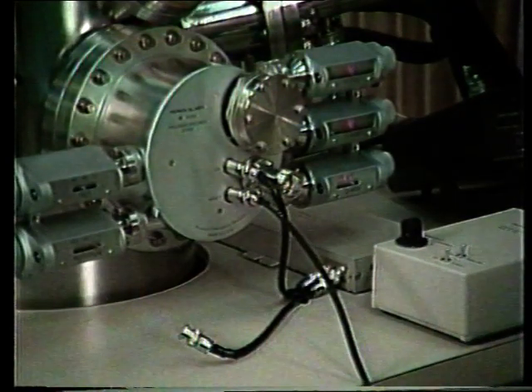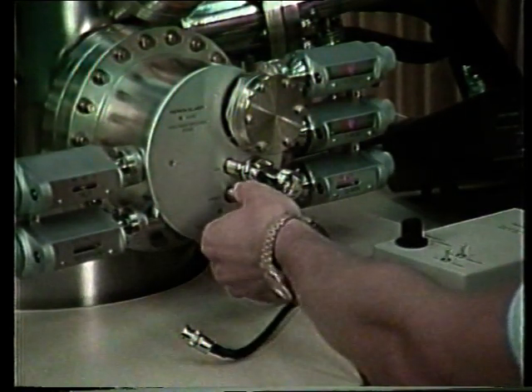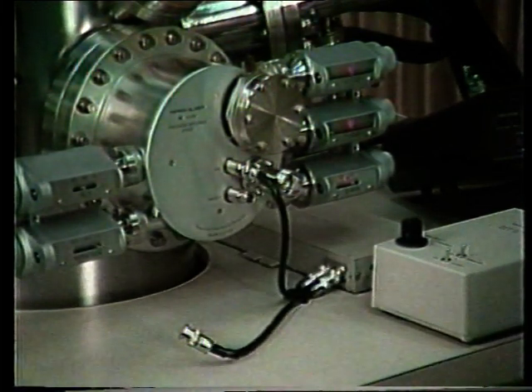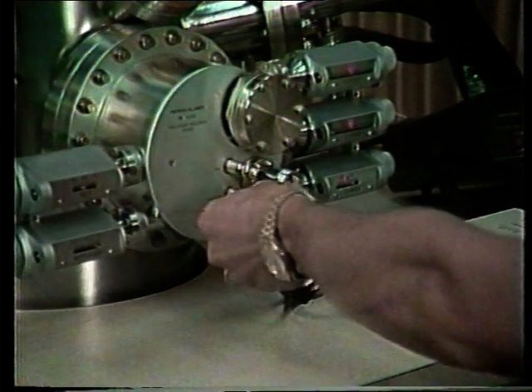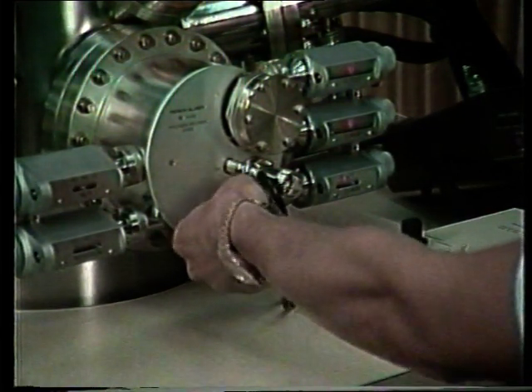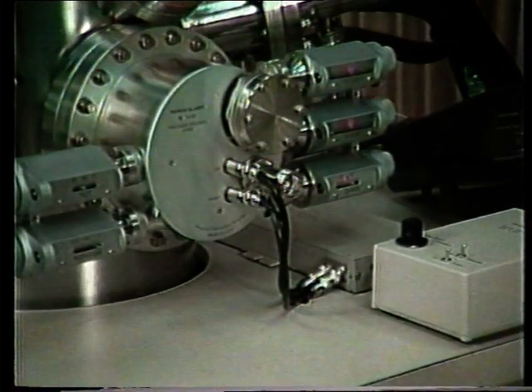With the electron gun now off, we are ready to disconnect the target lead from the battery box and reconnect the target lead from our absorbed preamp box. We now have the correct current for SEM images. Let's go back to the TV monitor and fine-tune the beam to obtain the smallest beam size.